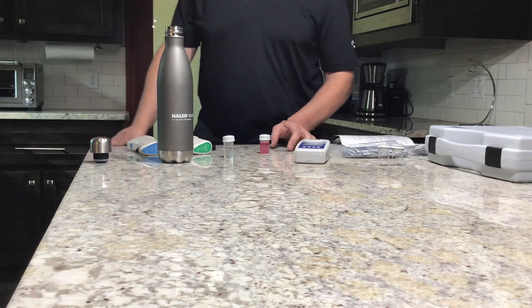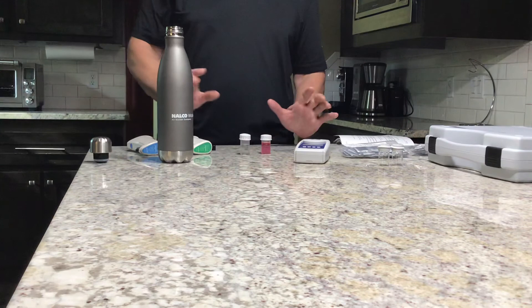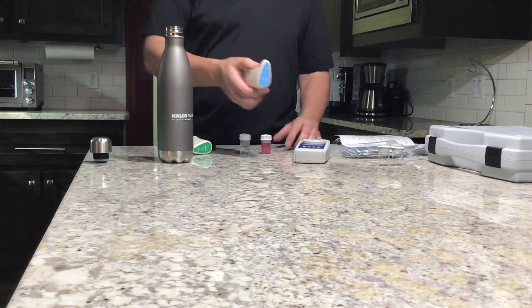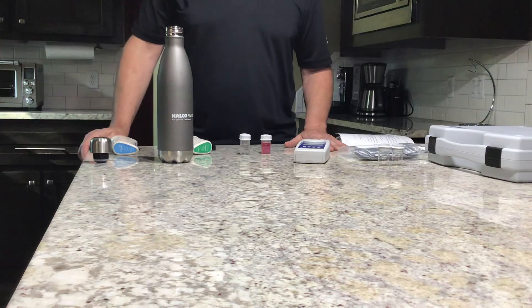If we were to take a free chlorine sample, we simply do the same thing — empty and rinse the vials a couple of times without soap, and then take the free sample from the swift test dispenser or use the pillow packs, two of those for the high range. And that's all I have for today. Thank you.